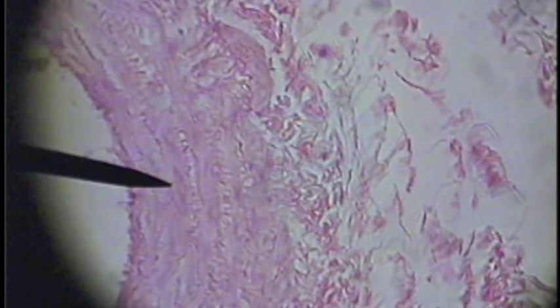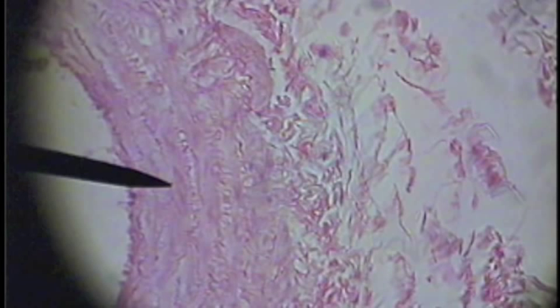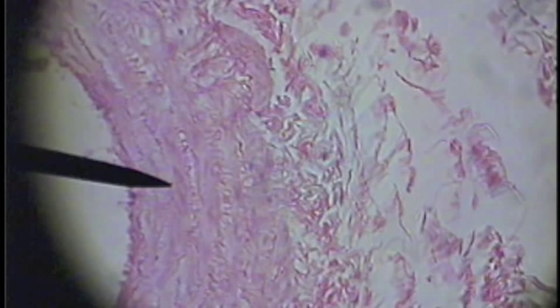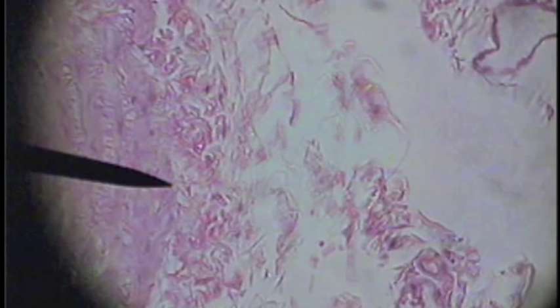Now the pointer is in the tunica media, the smooth muscle layer, and as you can see there is connective tissue — little layers of connective tissue — visible in the tunica media of a vein. The pointer here is at the separation between the tunica media and the tunica adventitia, or externa, of the vein. You can see connective tissue clearly on the right side of the pointer, but you can still see connective tissue mixed in amongst the smooth muscle of the tunica media of a vein.